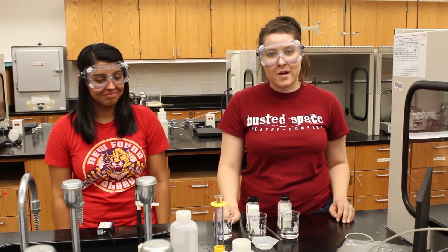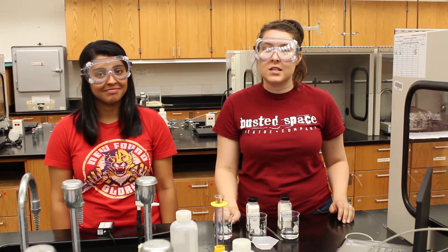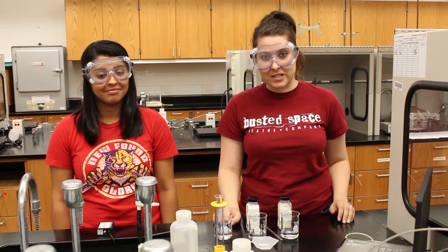Hi, I'm Katie, and I'm Sadie, and today's lab is all about conductivity and bonding. Conductivity is the measurement of a solution's ability to conduct electrical currents. This experiment will explore the conductivity of both ionic and covalent compounds.